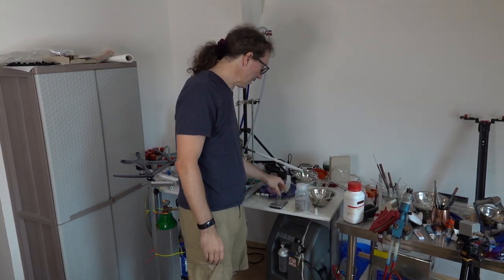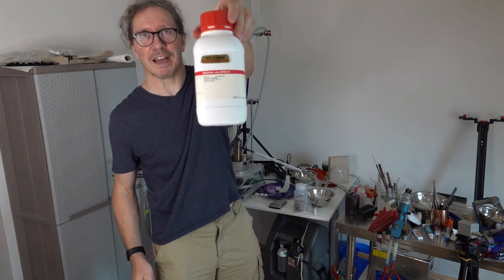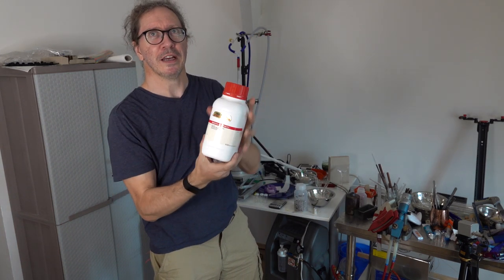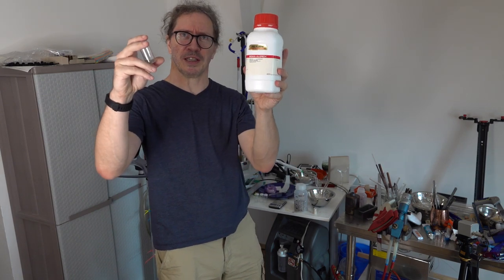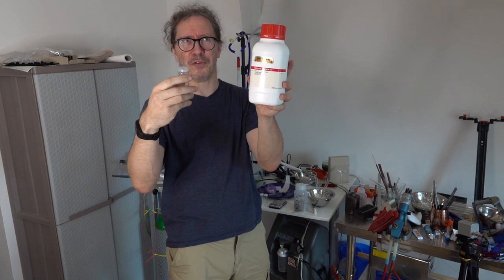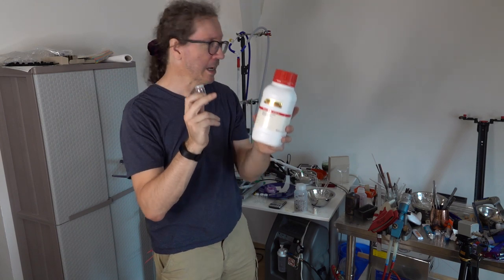Right. So what we're going to do is get some lithium, that's that stuff there, and some cesium chloride, there's that stuff there. You put your lithium into the cesium chloride. You melt this at about 650 Celsius. And at that point, the whole thing becomes a mix of cesium metal and lithium chloride.